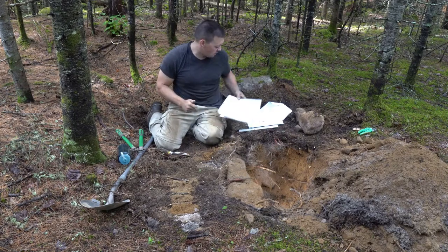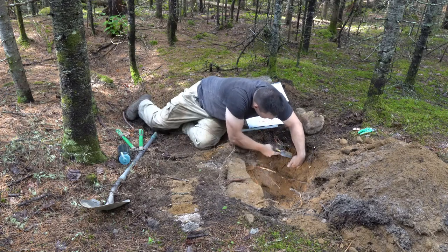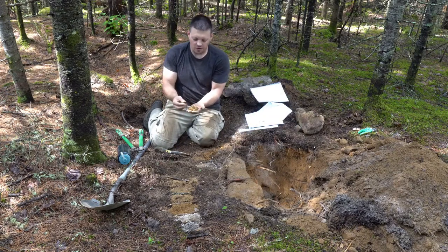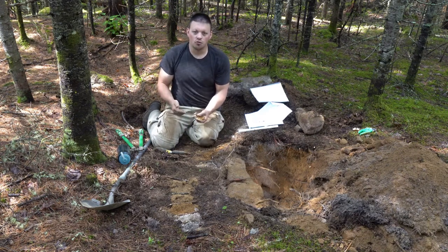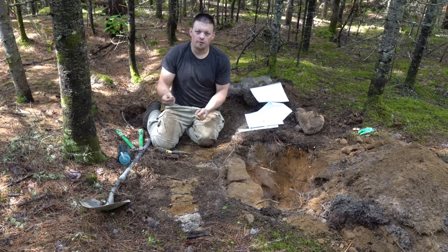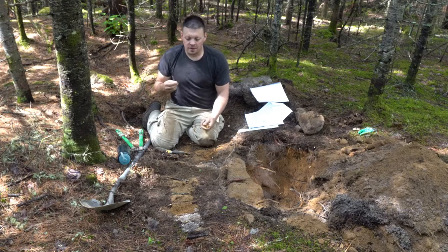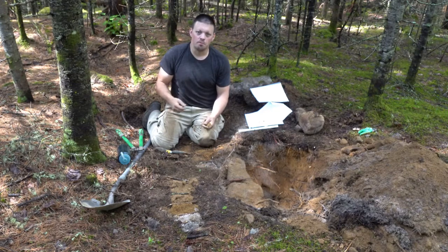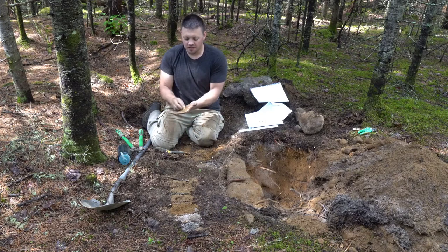It does take some time to get used to this. Our consistence is the soil's resistance to penetrability. So if we have some structure in our hand, how well does it hold together? Our options are loose, which means it has no structure, it's all individual particles. Friable means it holds together, but as soon as you put any pressure, it falls apart. Firm is it takes quite a bit of pressure between your thumb and your finger to break the aggregate. And very firm is it takes even more pressure. And compact, which means you can't break it even with your own body weight. So here we have a very friable consistency because it all falls apart the second you take it out.